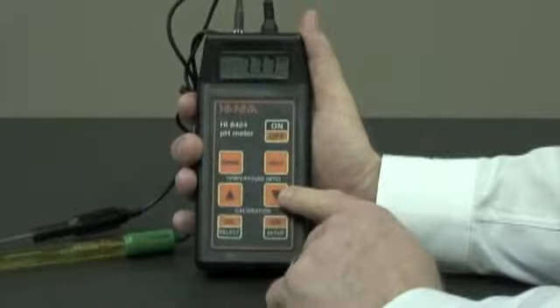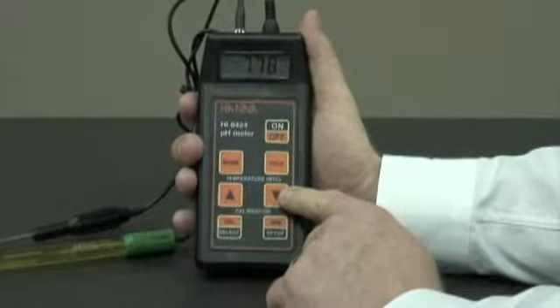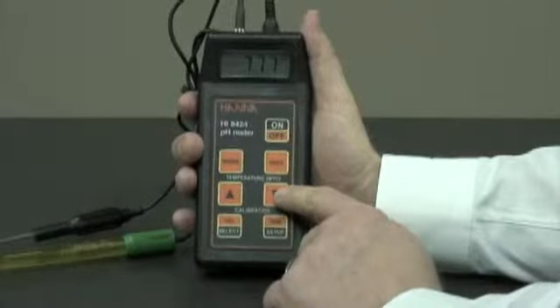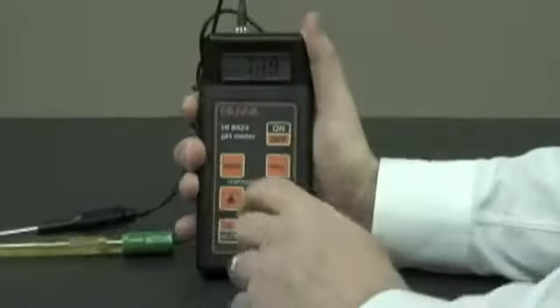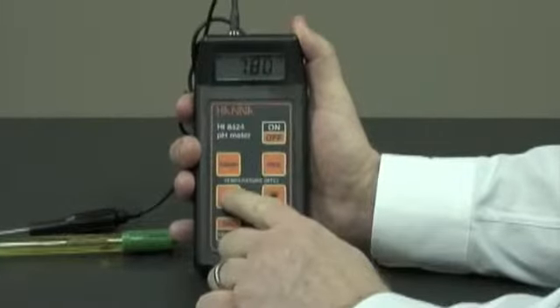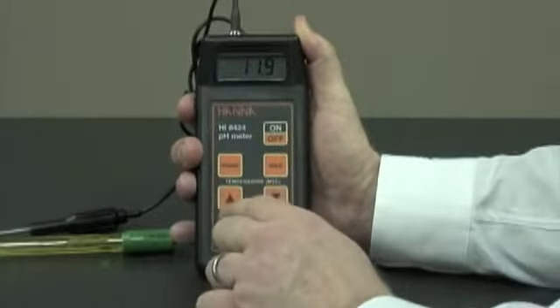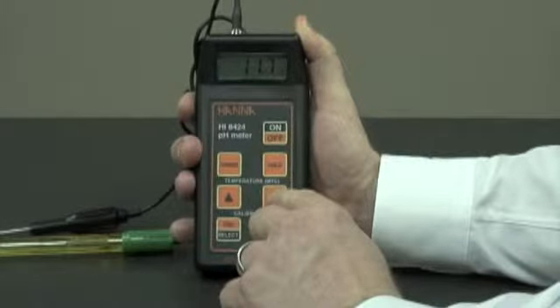Temperature buttons. Right now, with the temperature probe in, we have automatic temperature compensation. If we took the temperature probe out, we could use these buttons for manual temperature compensation and adjust it manually.